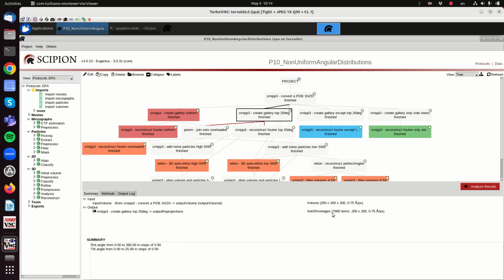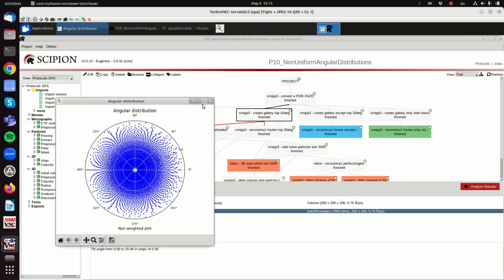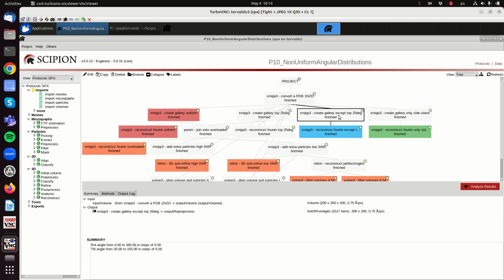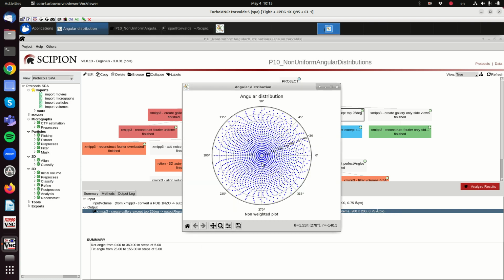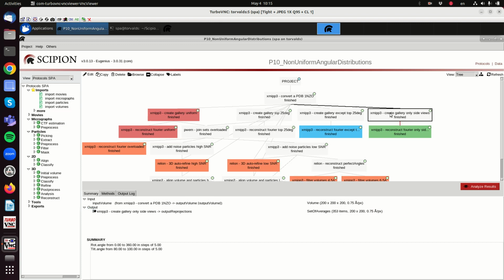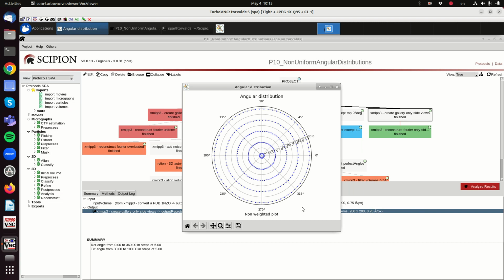So for instance, in this one most of the particles are coming from our top views, and then we have also all images except those in the top view. So the top view is less populated. You can see that it doesn't go to minus 25, and then we have also here only side views. If you look at the range, we have only side views.